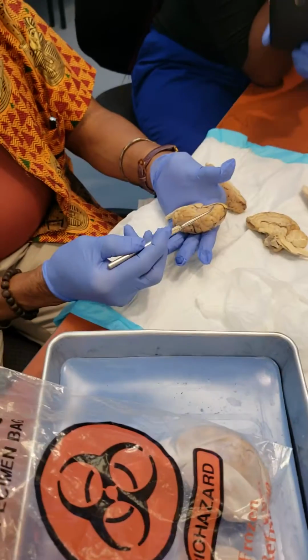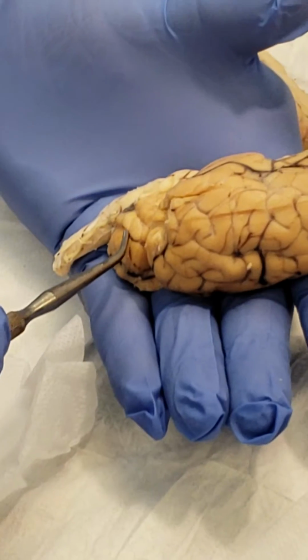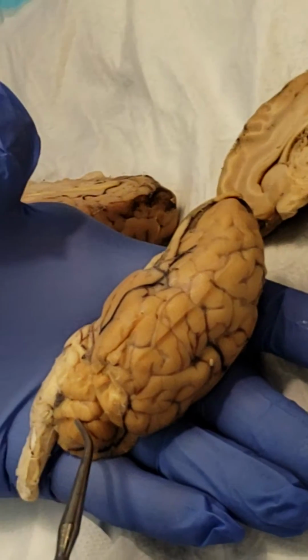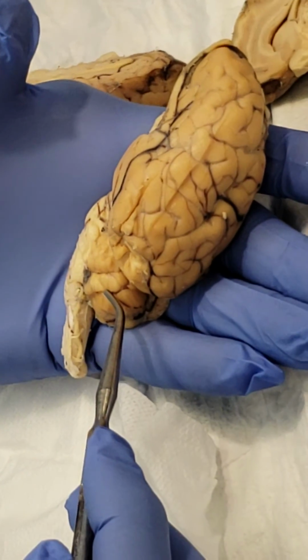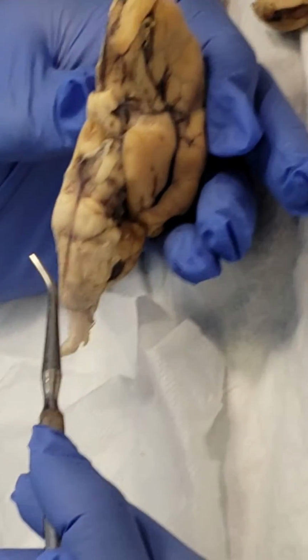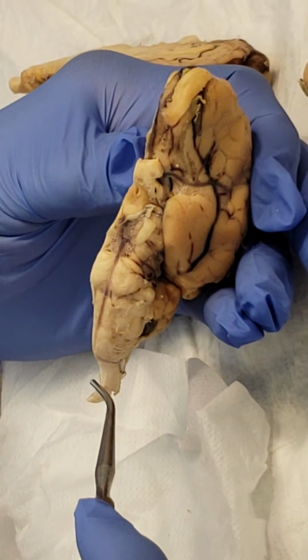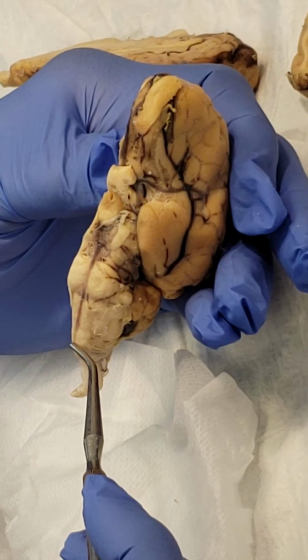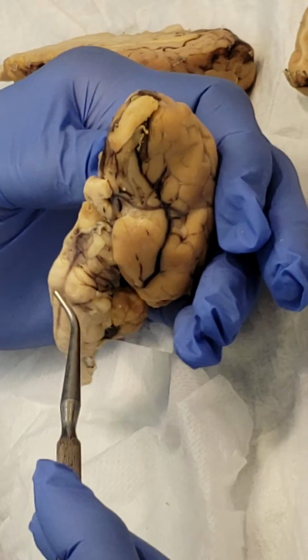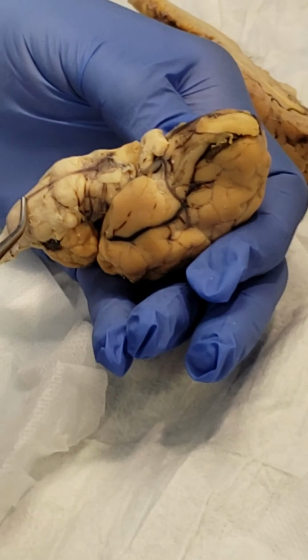Okay, now, so temporal, frontal, parietal lobes, occipital lobes. This is the, what? That's the cell. No, that ain't. That's a cell what? Cerebellum. Cerebellum. Now, the brainstem is part of the brain. Everything below this is out of the brain, out of the foramen magnum. Okay, so this is called the midbrain. Midbrain. This protrusion here is the pons, and this area here is the medulla oblongata.